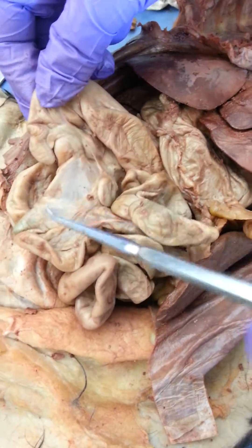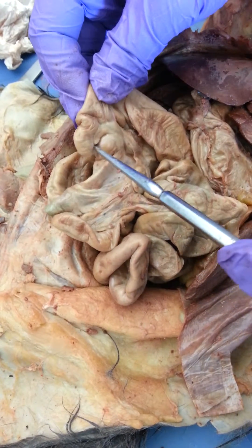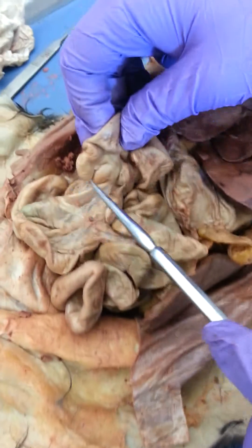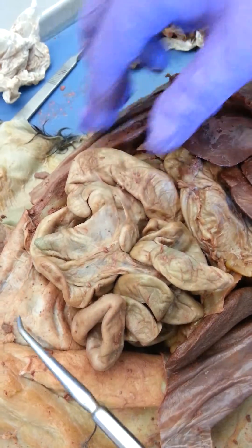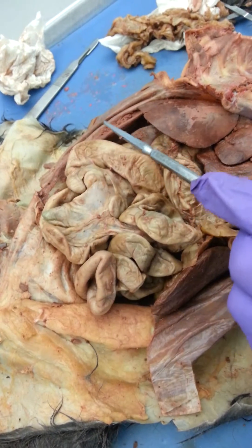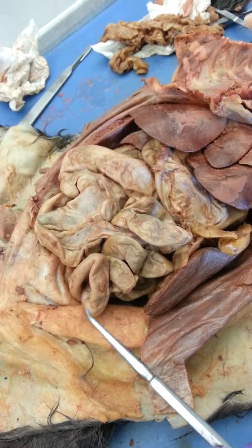The ileum is the small intestine coming in here, and this is the large intestine. This little overhang right here is the cecum. Then the large intestine goes up, across, and then down — so that's the ascending colon, transverse colon, and descending colon.